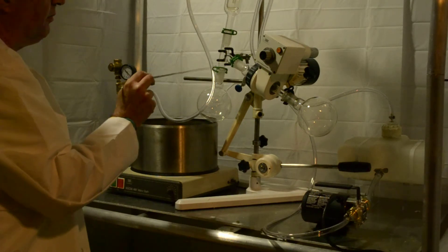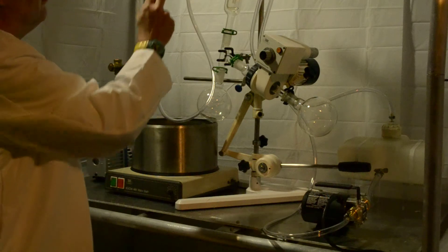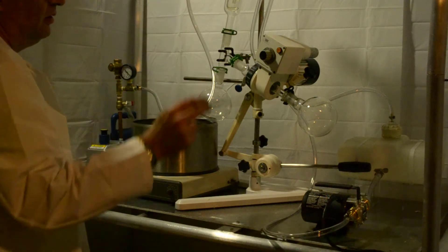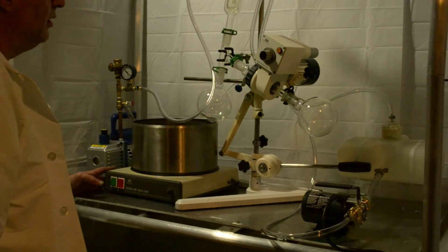Then you put on your T, clamp it off, put on your receiving flask, your condenser, your vacuum adapter, and your round bottom, your tub, and you're ready to go. That's about it. Thanks.